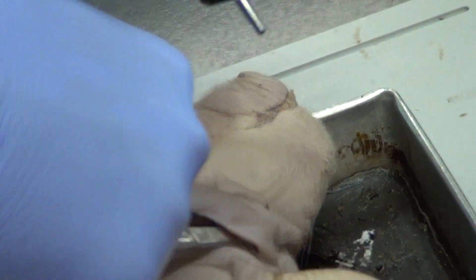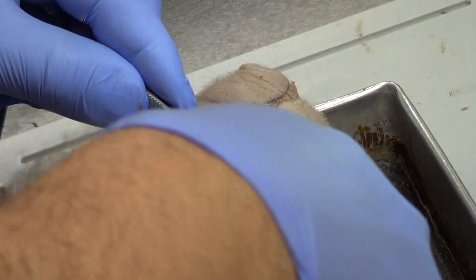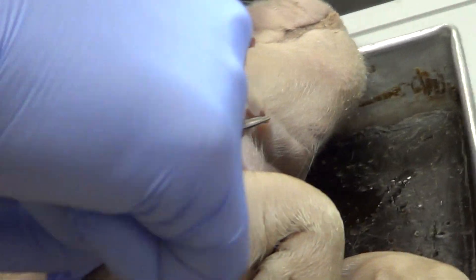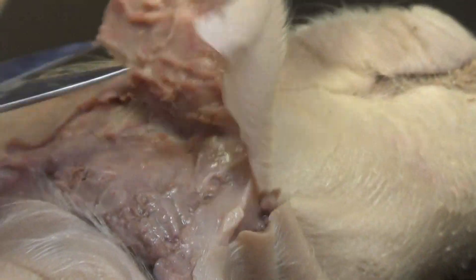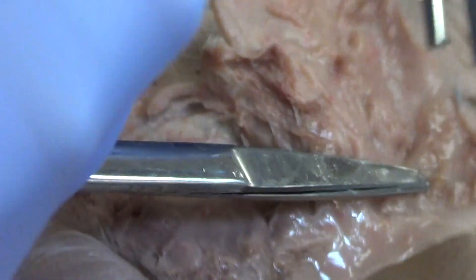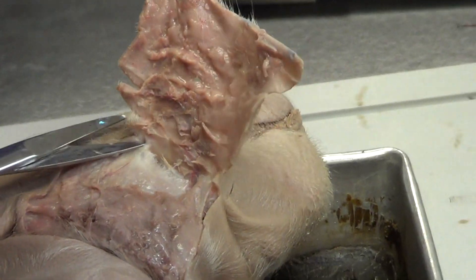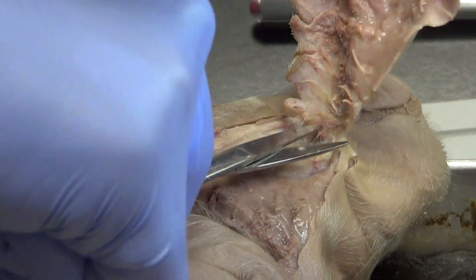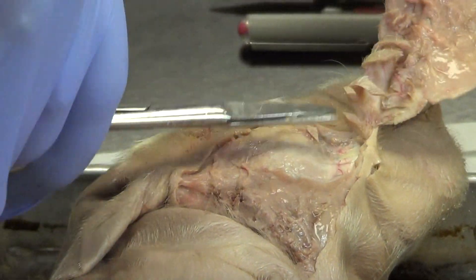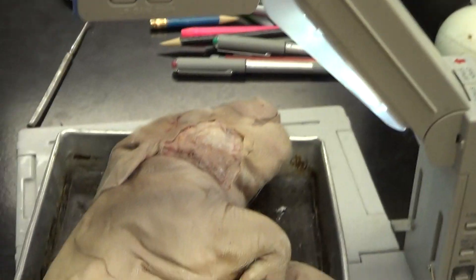For you all, you're not professional like me, so this will take a little bit longer. I'm going to start at the other end now. This flap will be thrown in the trash — there's my flap, goes in the trash.